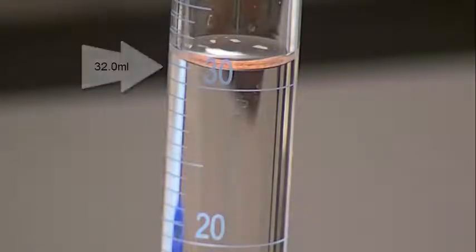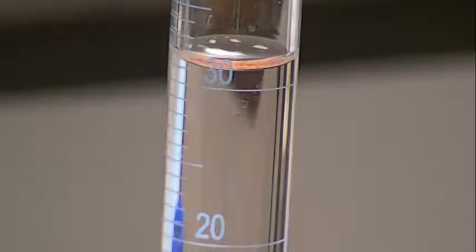My previous volume was 29.0 mL. So you can use your mass over volume equation. The volume displaced is going to be about 32 mL minus the 29.0 mL that I started with, and my mass is the mass that I weighed out. You want to get that mass to be around the 10 to 20 grams range, maybe 15 to 20 grams. It won't hurt whatsoever even if you weigh out 25 grams or 26 grams.